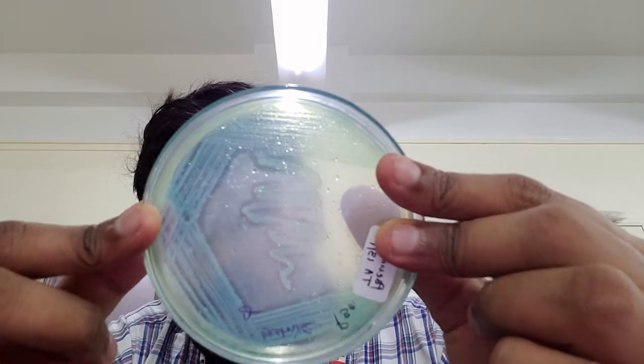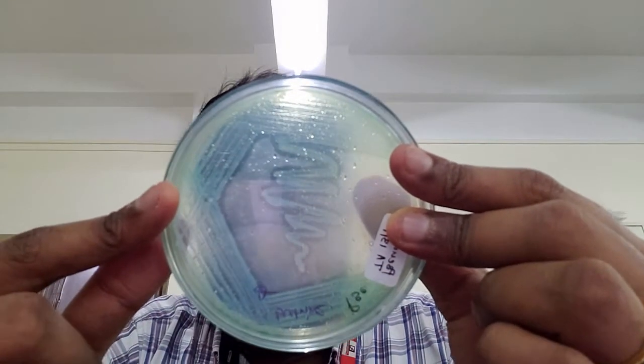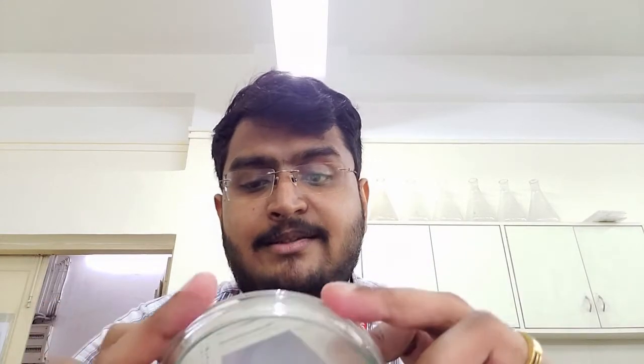I also passed Pseudomonas, which is known to be a lipase producer, and you can clearly see the clearance zone around the Pseudomonas streaks. This confirms that Pseudomonas aeruginosa is also a lipase producer. So all the strains passed here — whether Bacillus, Pseudomonas, or the unknown strain — are all showing clearance, though in the case of Bacillus it is very low, while Pseudomonas and the unknown strain show very good clearance.